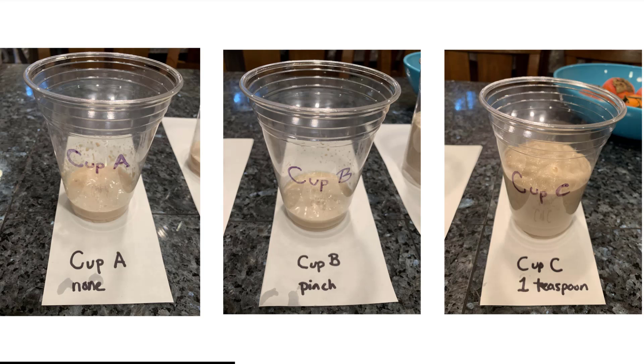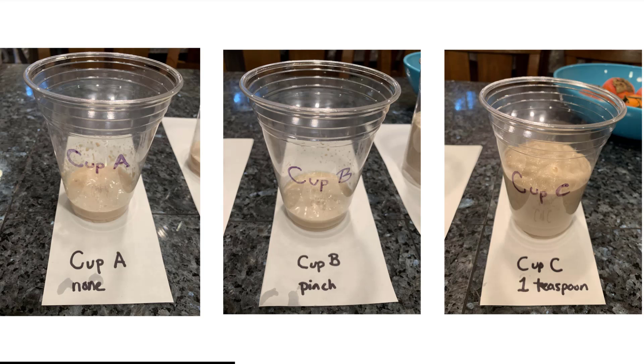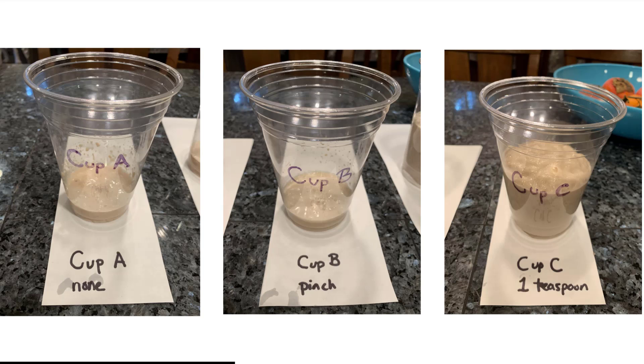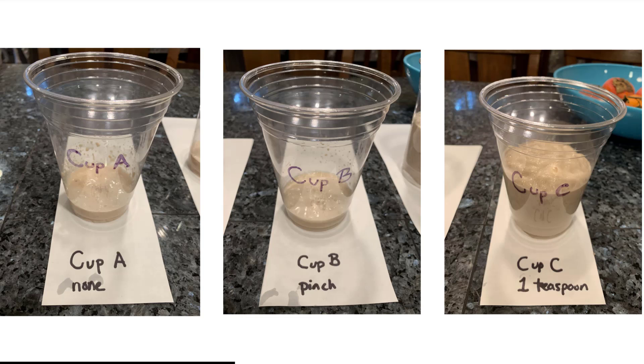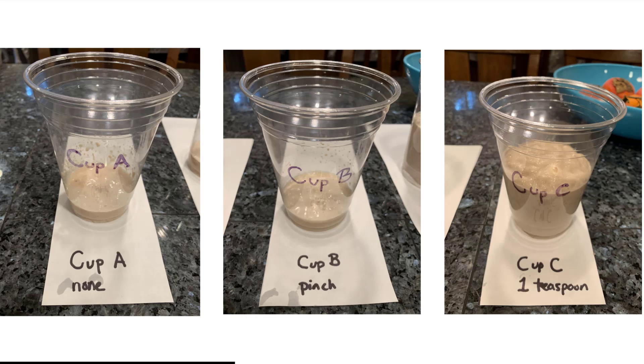Because we saw bubbles, we know that the yeast are releasing energy from sugar, an energy storage molecule, but we don't yet have any direct evidence that they are reproducing.